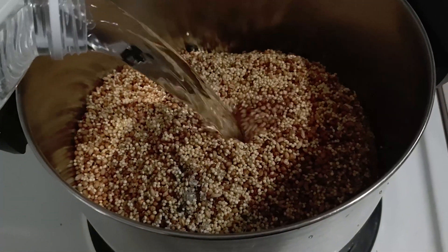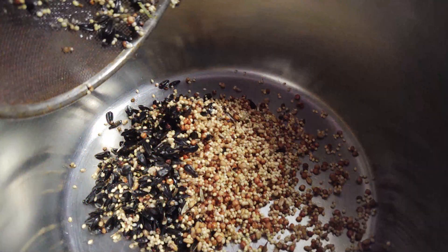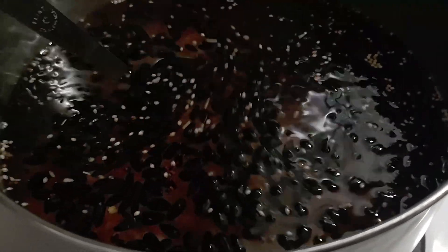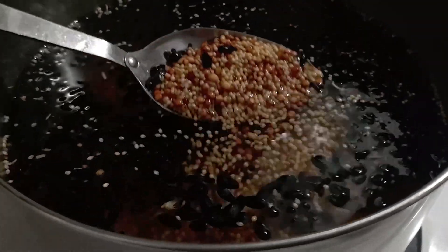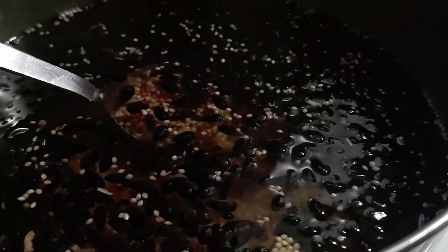Then simply rinse and strain. I've found that after doing two five-minute boils and one rinse in purified or distilled water, it's ready to go. You can see within the water — when it runs clear, it's ready.